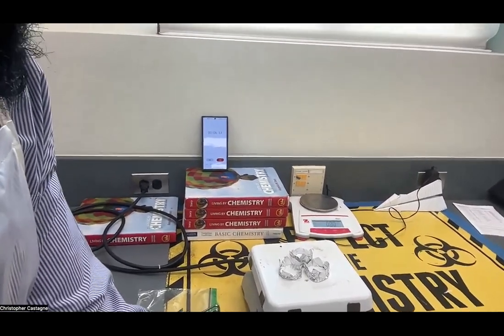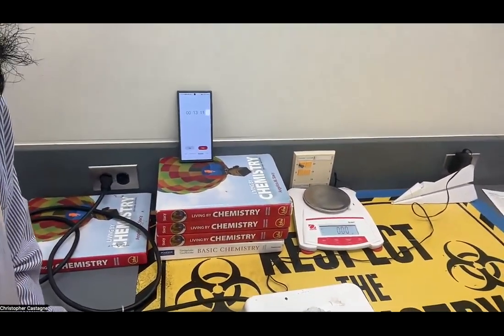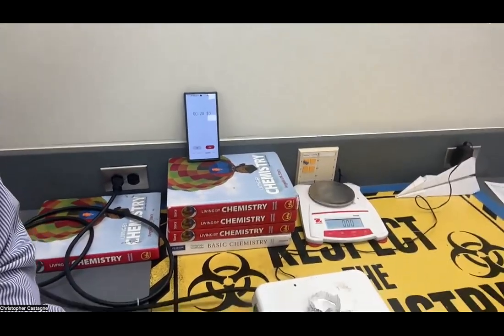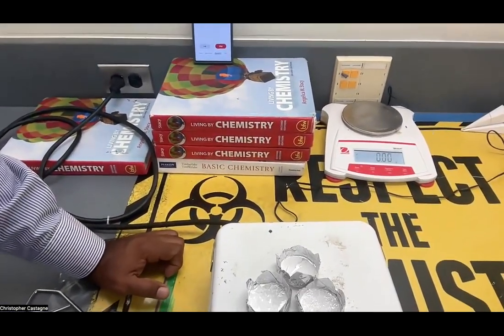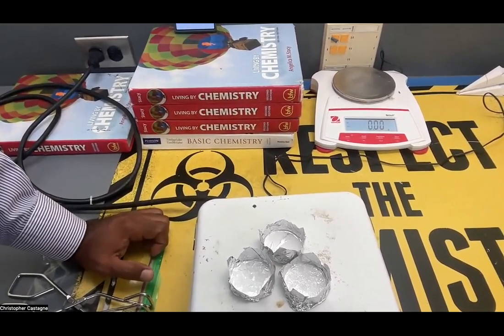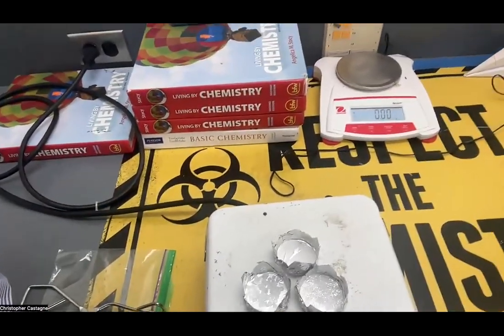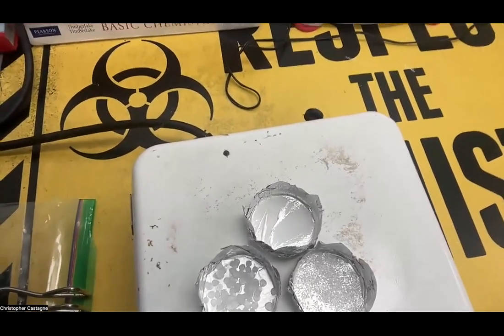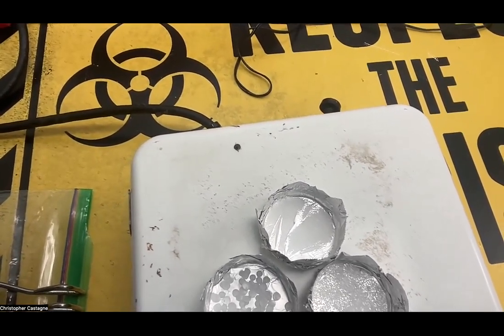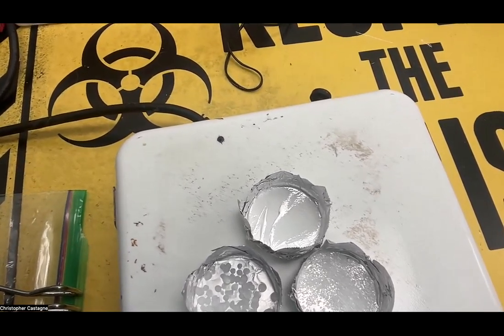I'll put it on seven. If the hot plate has been on for a while, I'd put it on four and then put the substances on after it heats up. We observe and look for melting — melting means turning from a solid to a liquid. We can see substance B has started to melt already, with white granules turning into liquid. It's definitely melting.